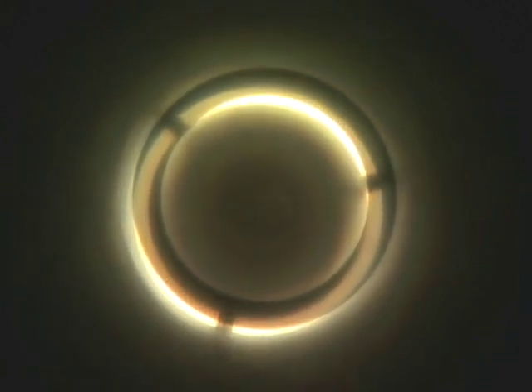When we look into our centering telescope, we are actually looking at the phase annulus and the ring that is etched on the objective itself. So the centering telescope focuses on both of these things.